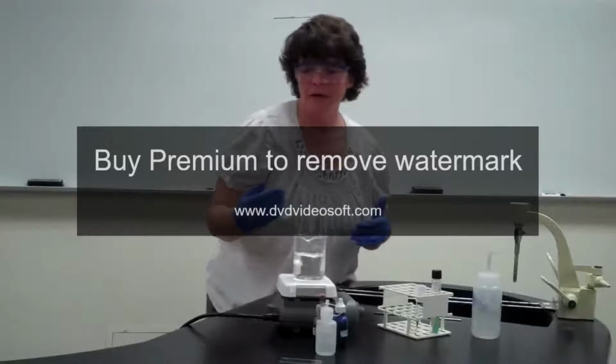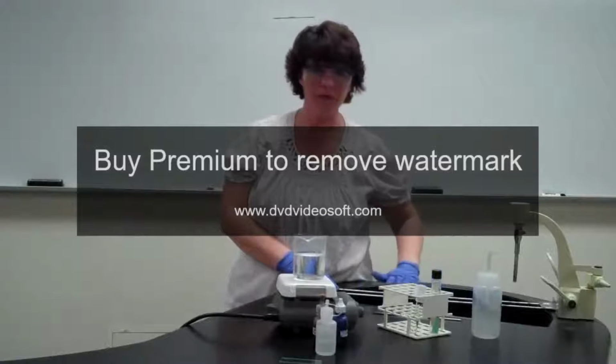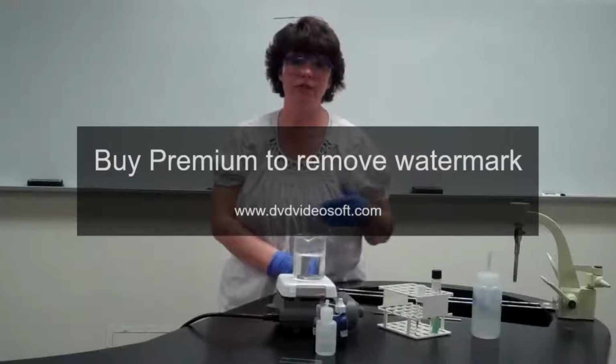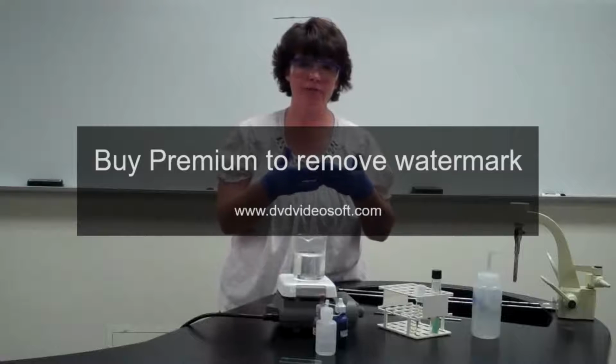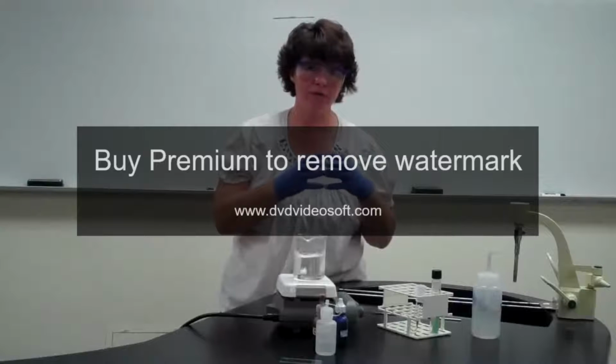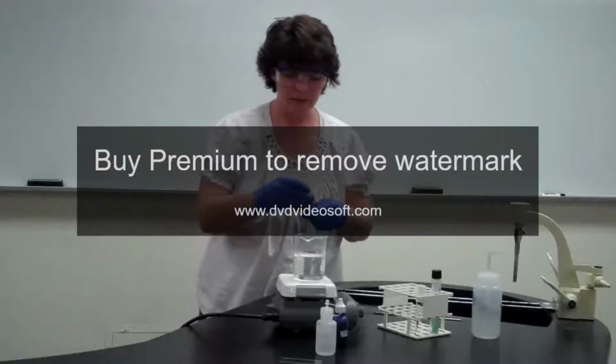In our lab manual, it just says to flood the smear with the carbol fuchsin and allow it to sit for 5 minutes. I'm going to use a different procedure, and we're going to use heat to try to get the stain to actually penetrate the bacteria. Because of that waxy coat, it's really hard for the stain to penetrate the wall. So that's going to be the first change that you're going to see.